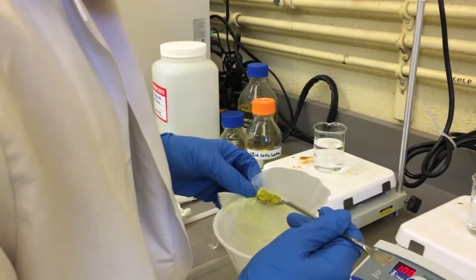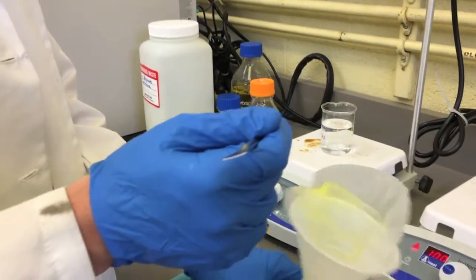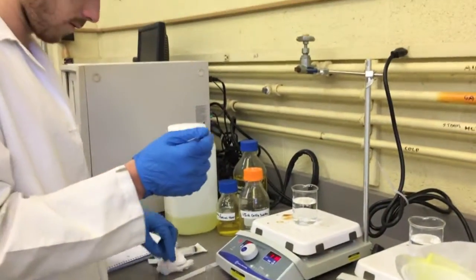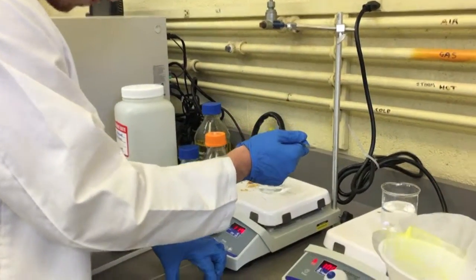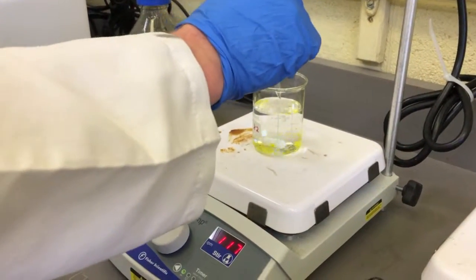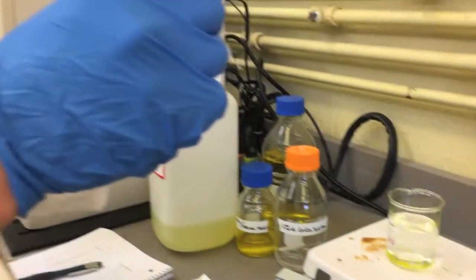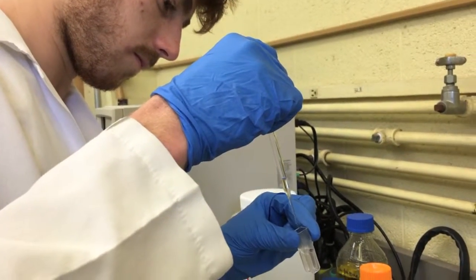Additionally, when we dropped the completed beads into our beaker of water, there was sometimes some tartrazine solution on the outside of the beads. This would immediately be mixed into the solution and would show up in our initial reading. In order to prevent our initial readings from being so erratic, we could add a step in the procedure where we rinse the beads before dropping them in. This should get rid of any excess tartrazine on the outside of the beads and hopefully yield initial readings that are close to zero.